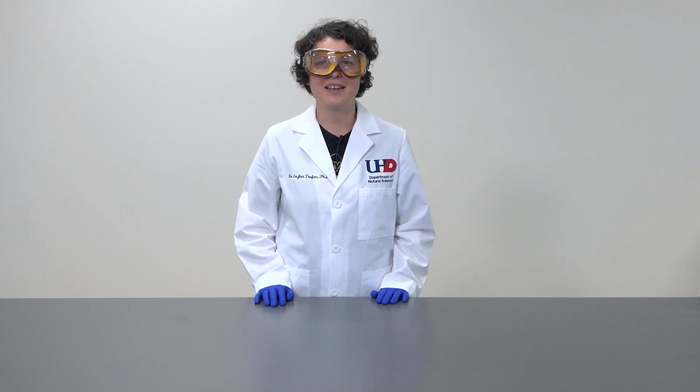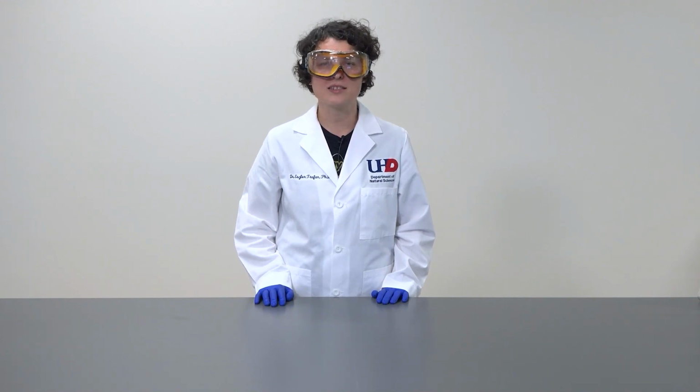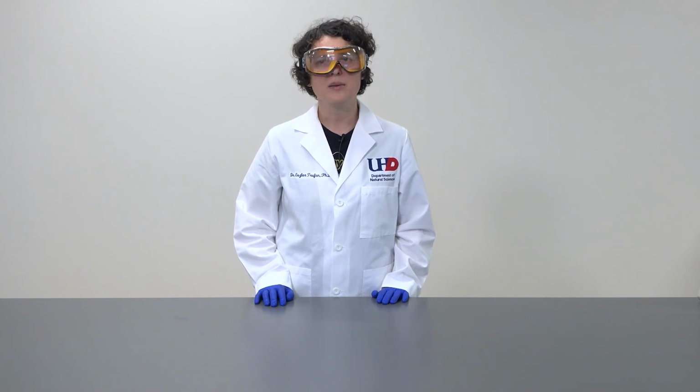Dr. Esther Trufan, and in this video, I am going to demonstrate an equilibrium experiment. In fact, we will be looking at the solubility constant of carbon dioxide in water and how we can impact that solubility by raising and lowering the temperature associated with it.